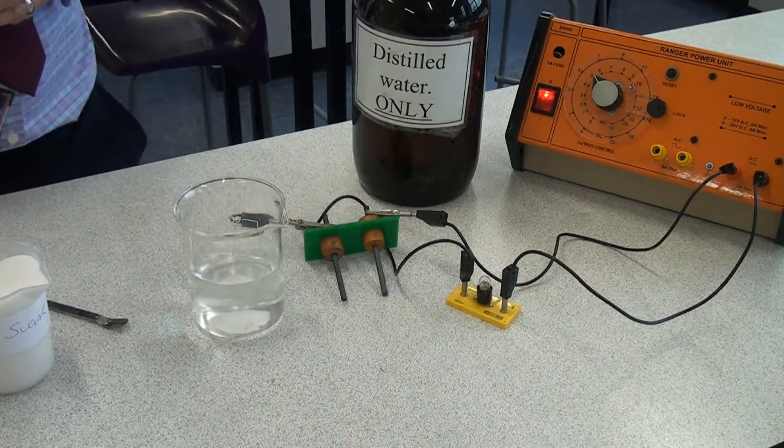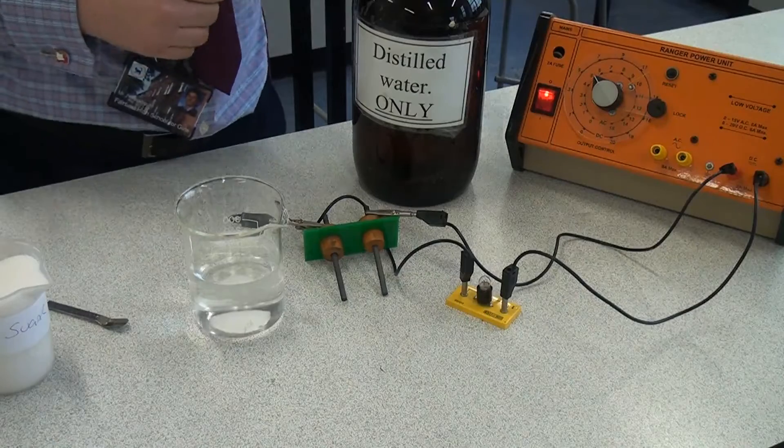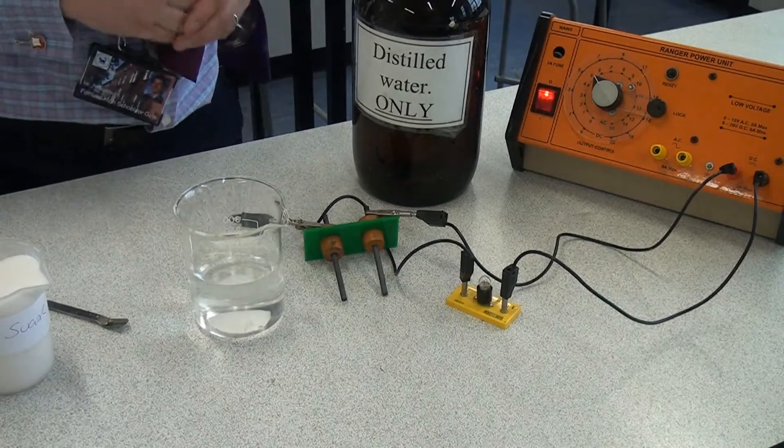Obviously don't try this at home putting electricity through liquids. It can be very dangerous. I'm using a very small supply of electricity.